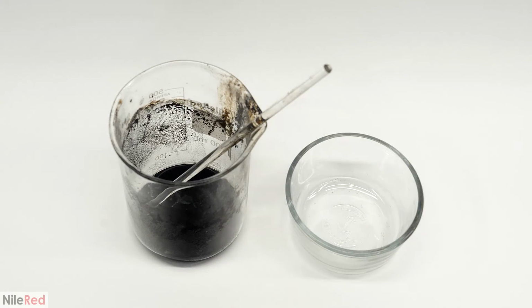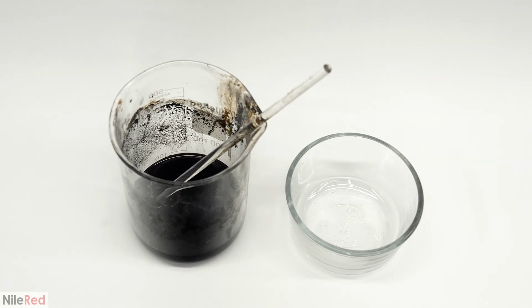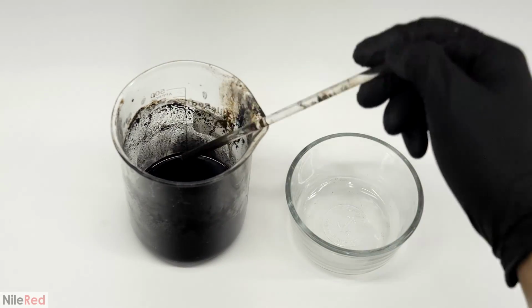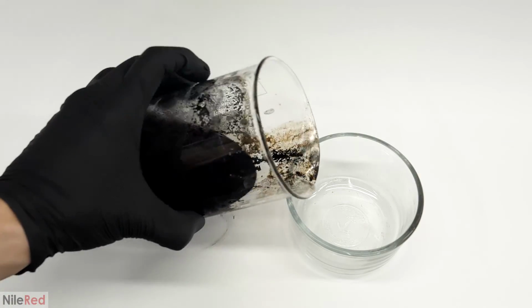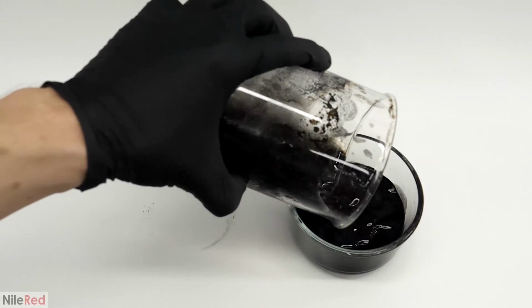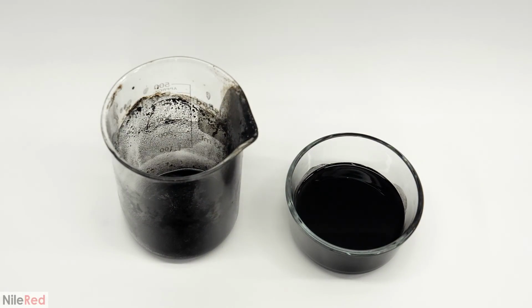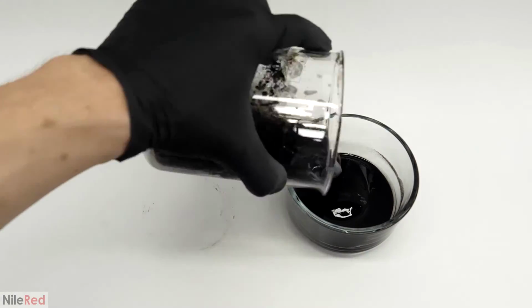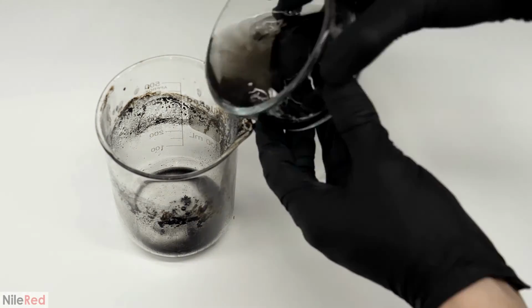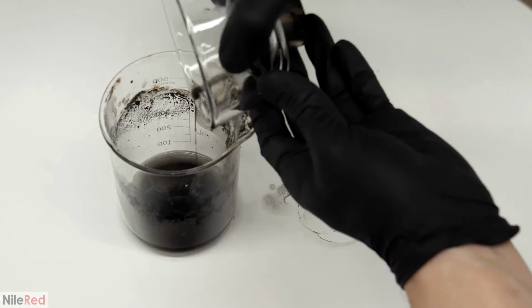All the washing steps were now done, but I had to somehow get it all out of the beaker and into this bowl. Doing this manually though, with a spoon or something, is a huge pain. I found that the easiest and also the cleanest way was just to add some more alcohol, mix it around, and dump it into the bowl. I then separated the alcohol with a magnet and dumped it all back into the beaker. After doing this a few times, pretty much all of the magnetite was eventually transferred.